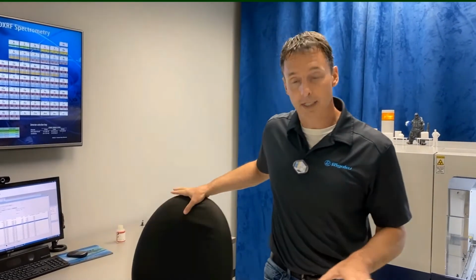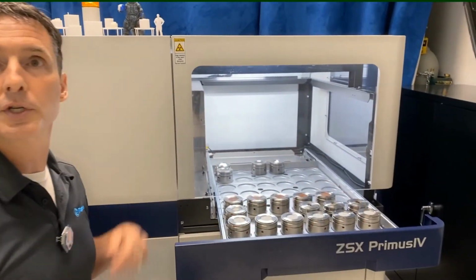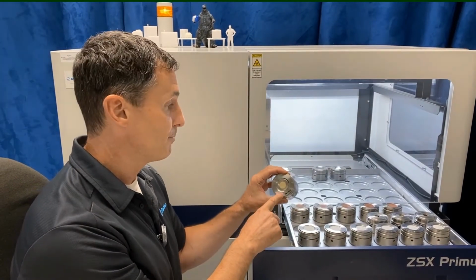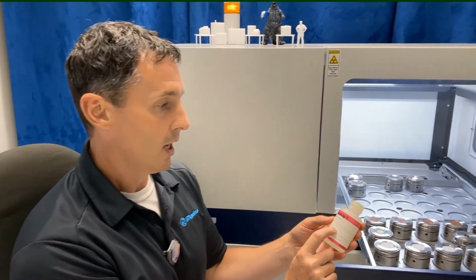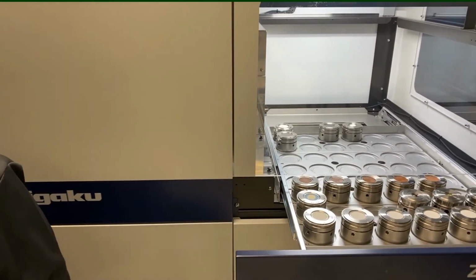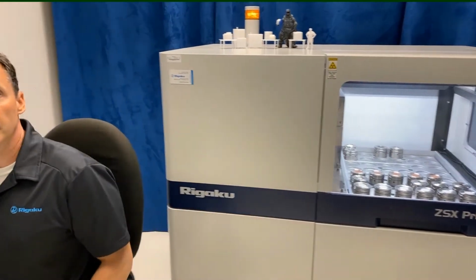So basically what we did last time was we prepared filter papers. If you remember, we had a set of Whatman filter papers. We were going to do a calibration curve, so we're going to show you that through a quant method. And then we also are going to do a semi-quant where we did an ultra carry. We took an all-purpose multi-element standard, an ICP standard, which has different levels for a set of different elements. So we put that on here, 250 microliters, and then we prepared the quant method, and we're going to show you on our system how we set those up and run samples. All right, so let's get started.